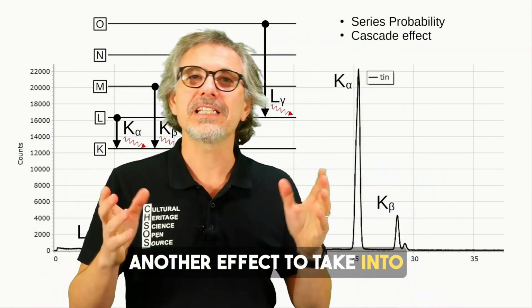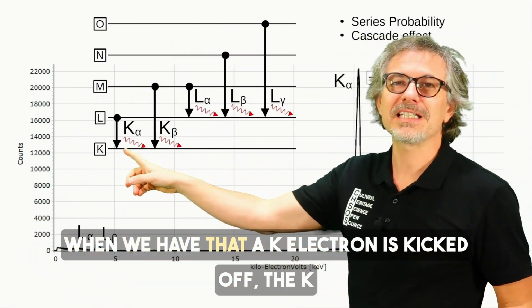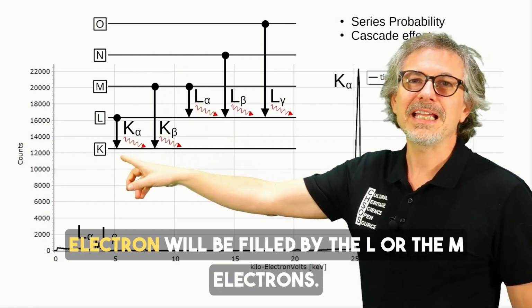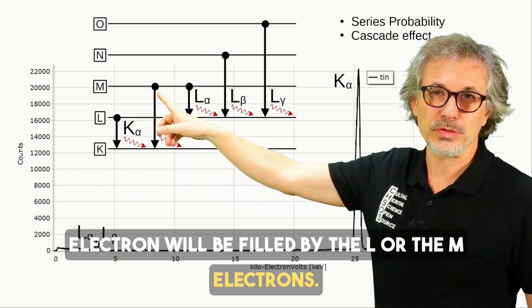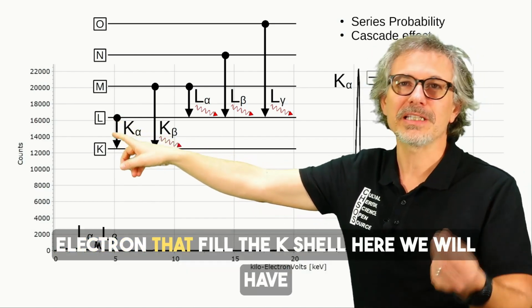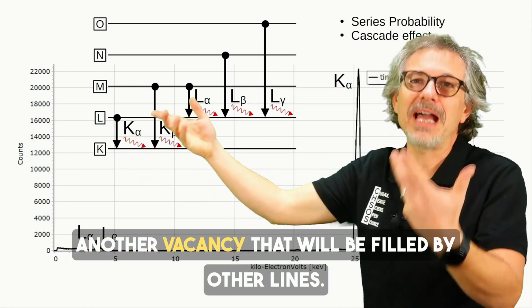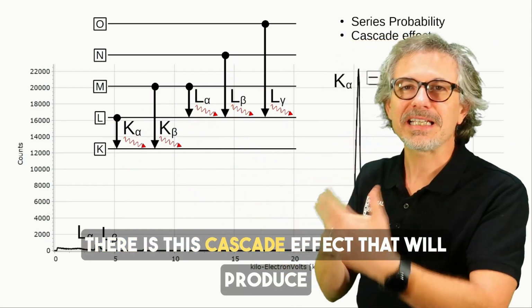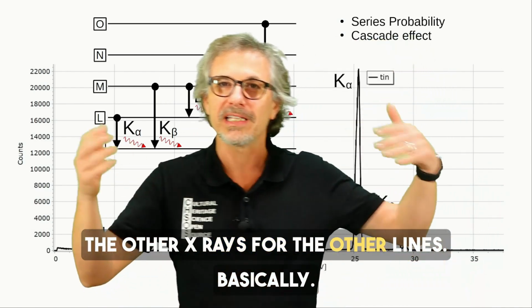Another effect to take into account is the cascade effect. When a K electron is kicked off, the vacancy will be filled by the L or the M electrons. But then, if it is the L electrons that fill the K shell, we will have another vacancy that will be filled by other lines. There is this cascade effect that will produce the other X-rays for the other lines, basically.